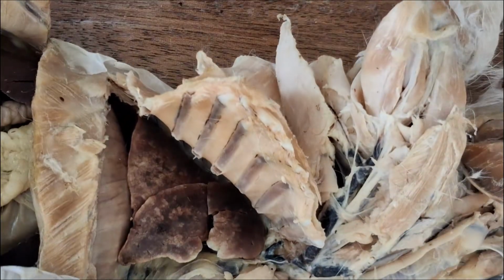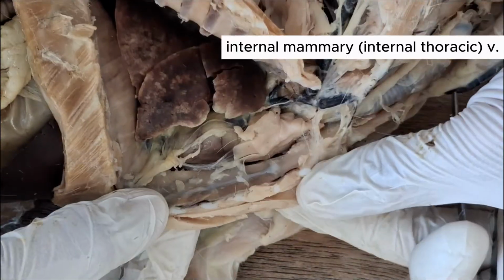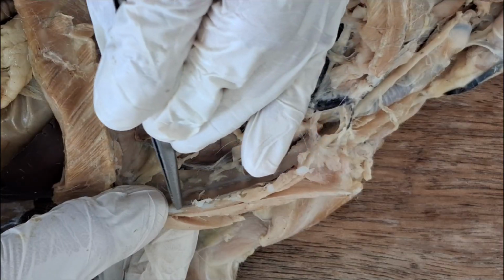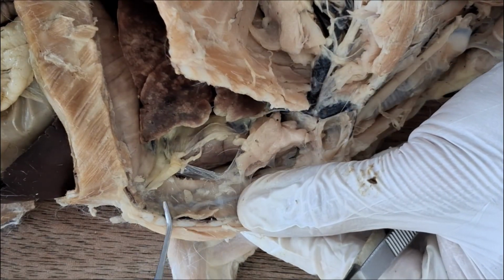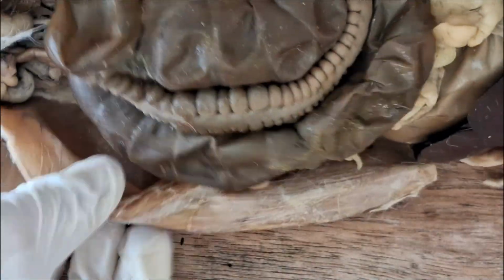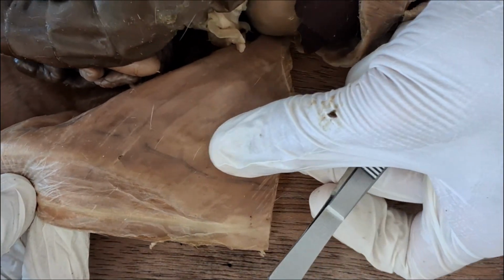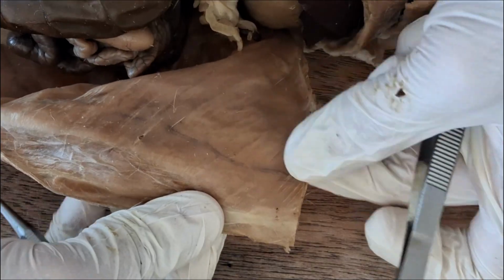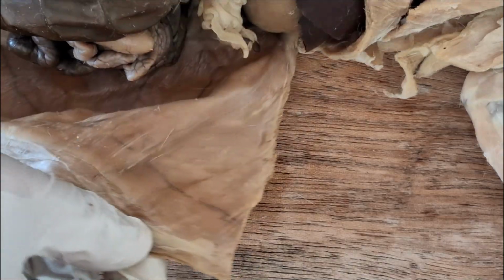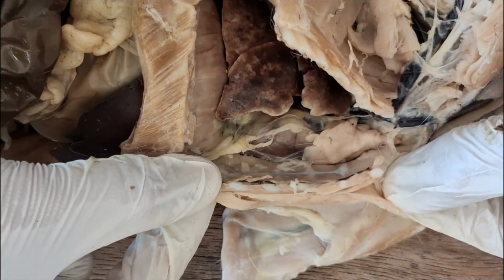And then another one draining into the precava is the internal mammary vein. Crawls over or under the sternum. Internal mammary vein. And it goes straight downward to the abdominal wall. Those veins crawling on the abdominal body wall would be the superior epigastric vein. It's a continuation of the internal mammary vein.